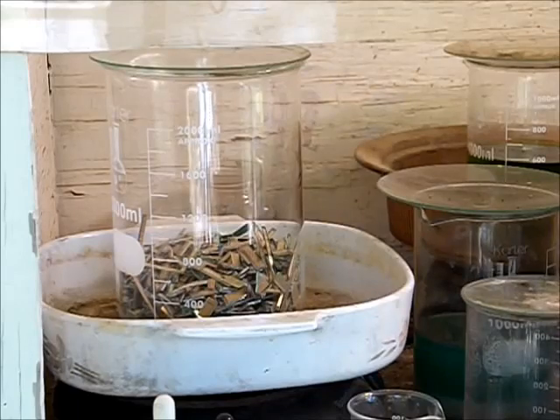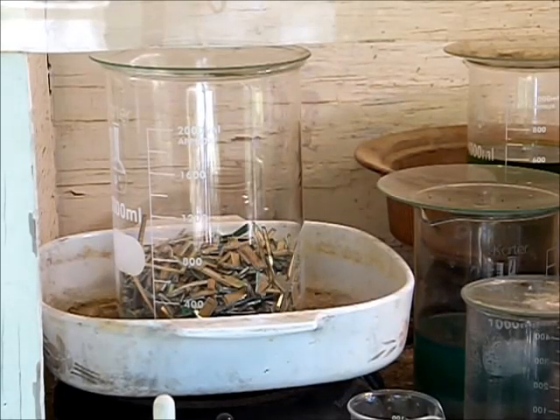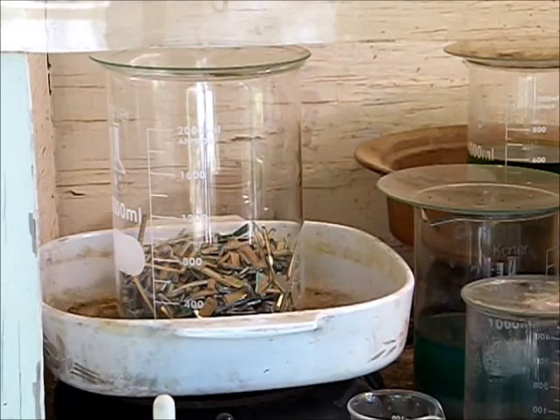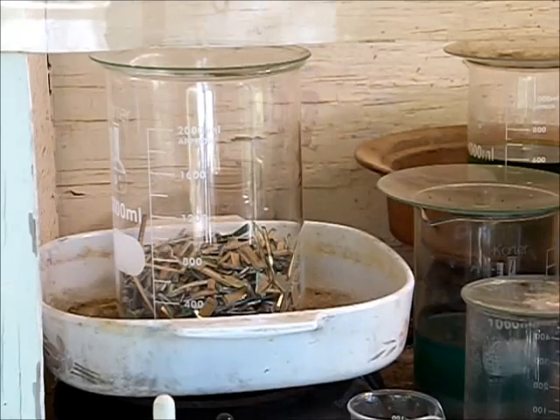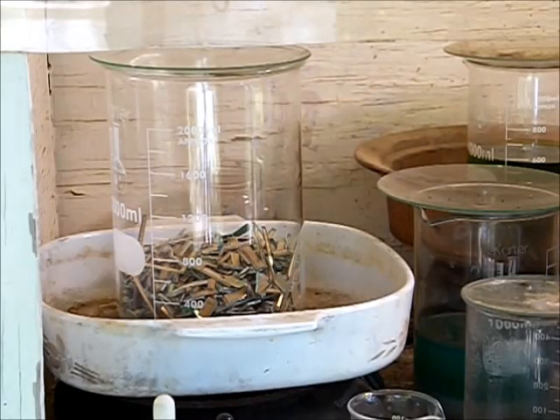We're going to be using some tap water. I don't think that using distilled water or deionized water is necessary because there's no silver involved. You can use this process with silver, but you have to use distilled or deionized water for that or you will create silver chloride.